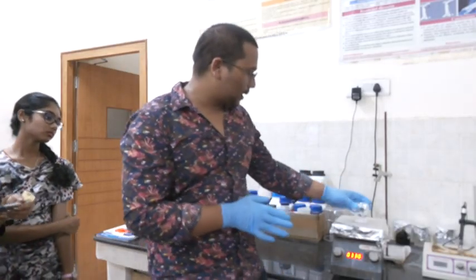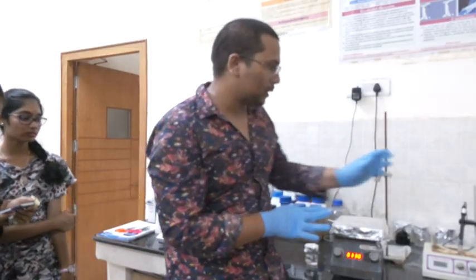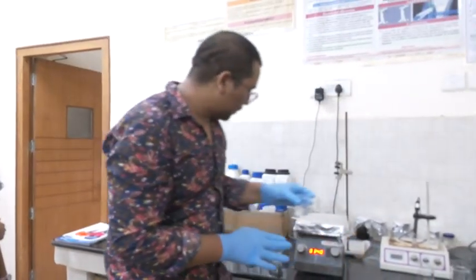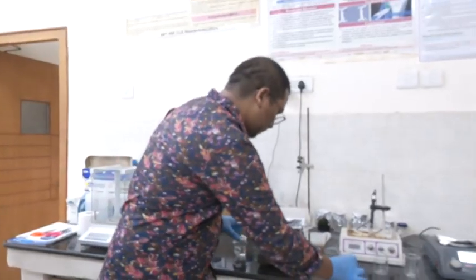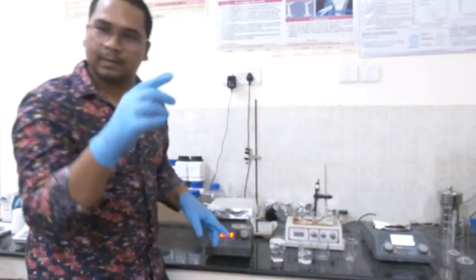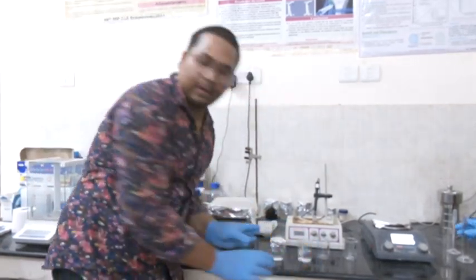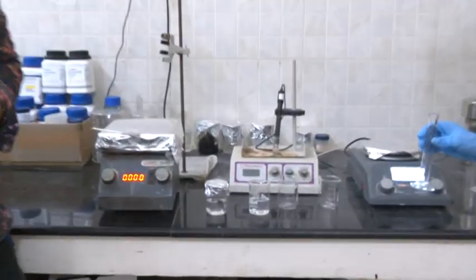We have already prepared 2 molar HCl and 2 molar NaOH. From this we will take 17.5 and 17.6.